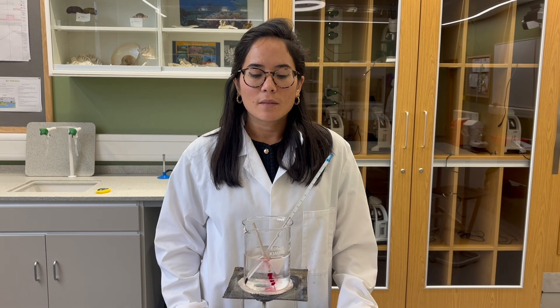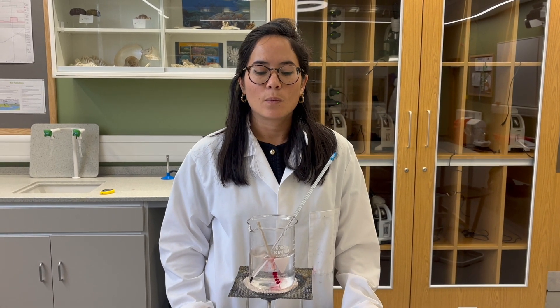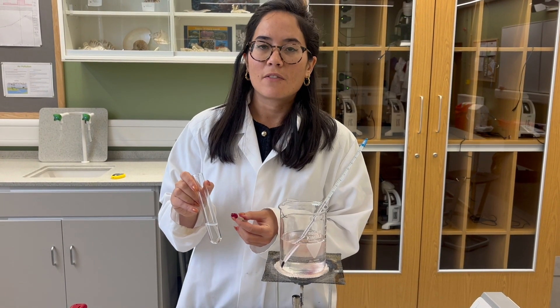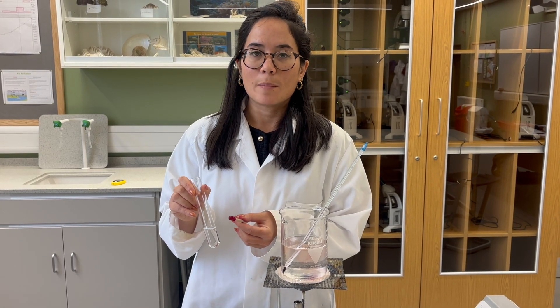In this first experiment we've reached 30 degrees Celsius. We'll make sure that beetroot is soaked for one minute before removing it, and then we'll place these cylinders in the distilled water and leave that for half an hour before using the colorimeter.